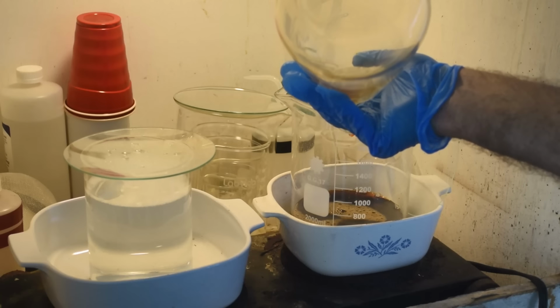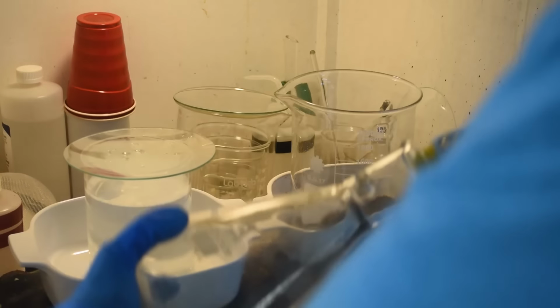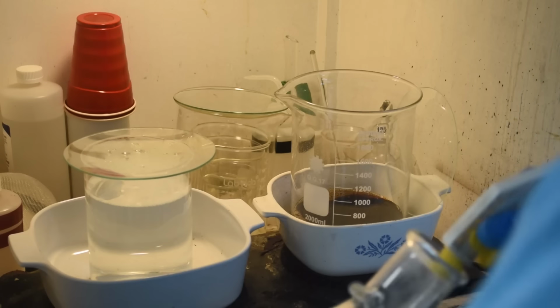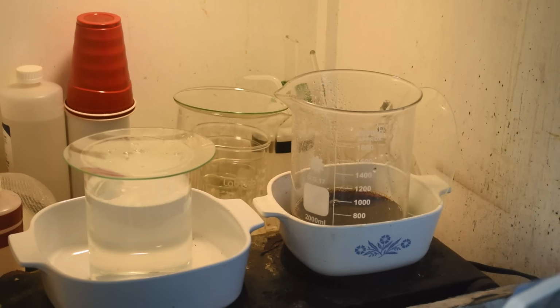Let me get the rest of our liquid in here, and we'll start heating it up. Make sure we get it all out of this beaker. We want all of Joven's palladium. Or I should say out of this flask.